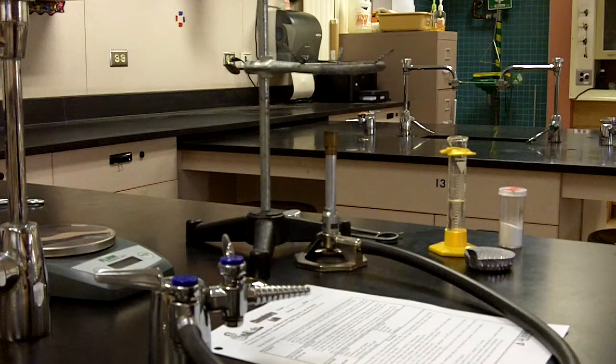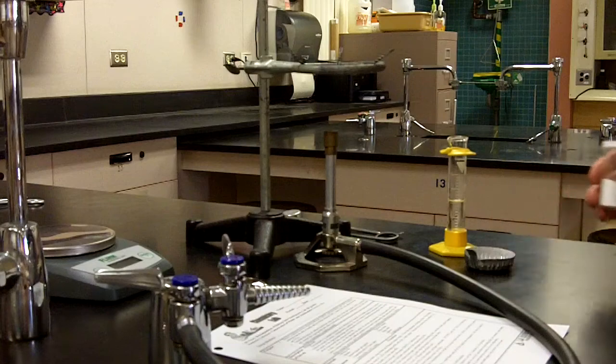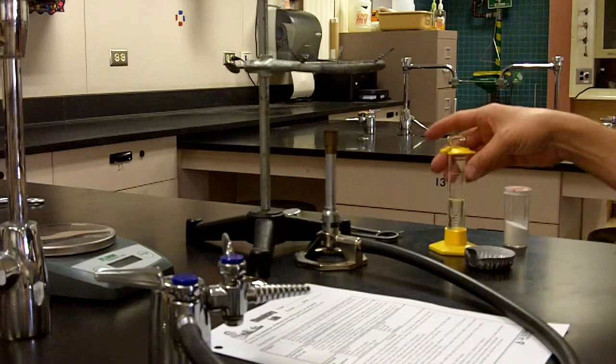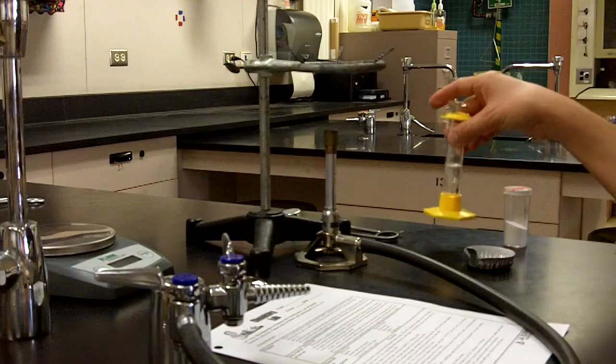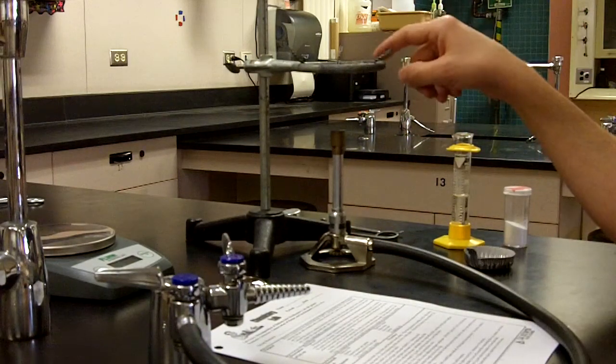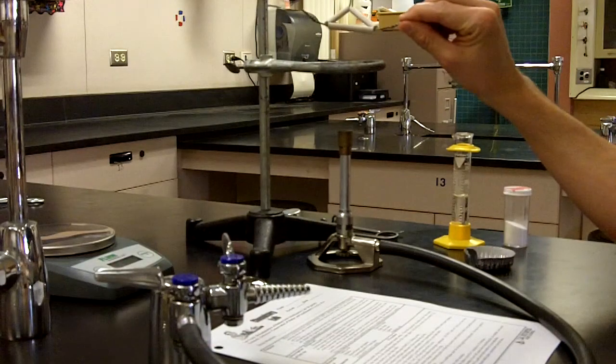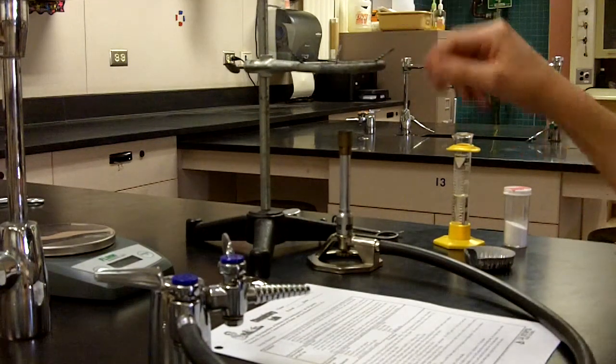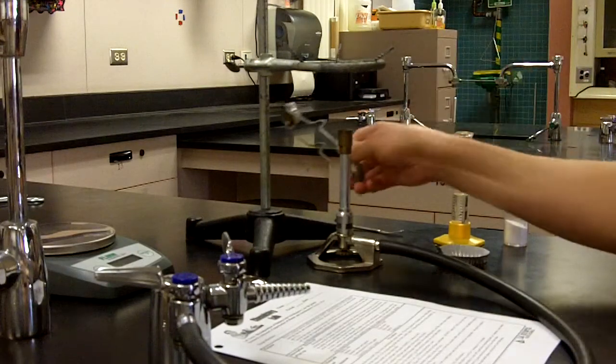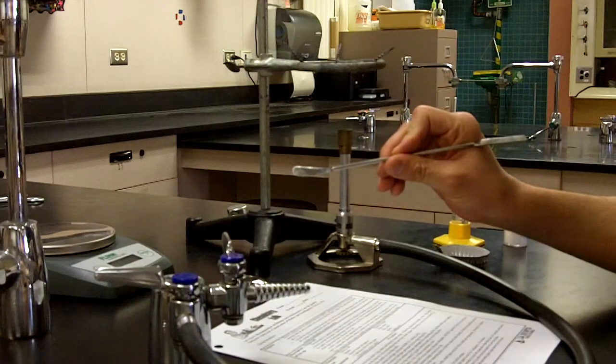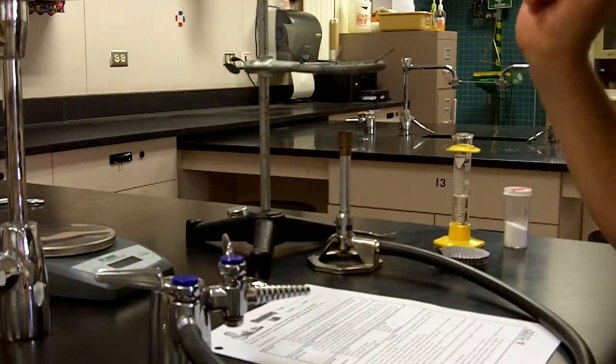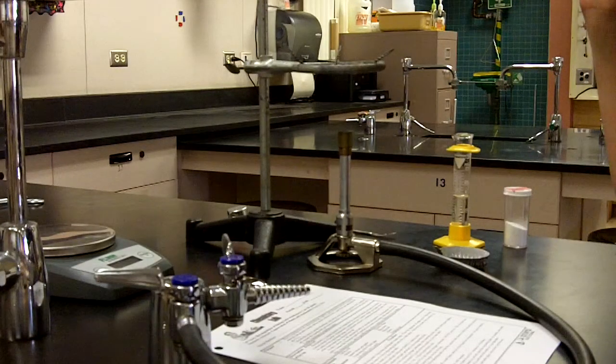Our materials: we're going to be utilizing some baking soda. The formula of the baking soda is NaHCO3, this white powder. Also, I'm going to be making use of some HCl pre-measured in this graduated cylinder. We have our Bunsen burner underneath our setup for this ring stand, which contains the iron ring, this clay triangle which will act as the place where the evaporating dish sits while it's being heated. We have the striker to ignite the Bunsen burner, a chemical scoop to obtain the desired quantity of sodium hydrogen carbonate, and the electronic balance so we can get the designated mass of the baking soda reactant.